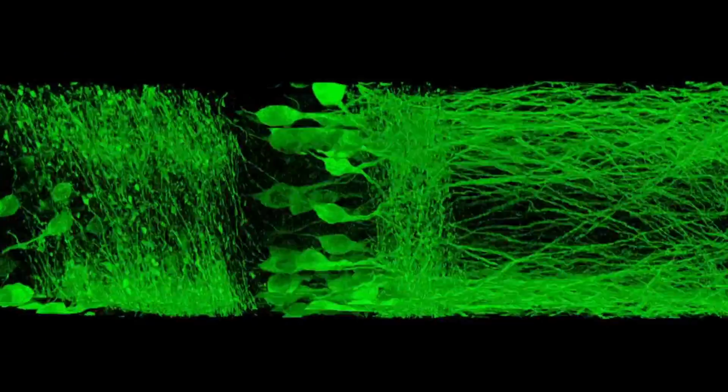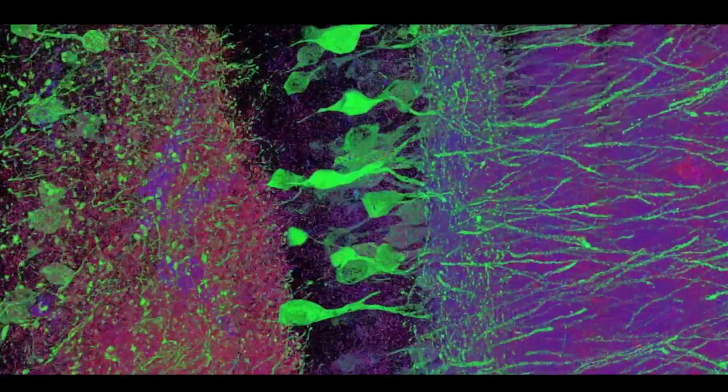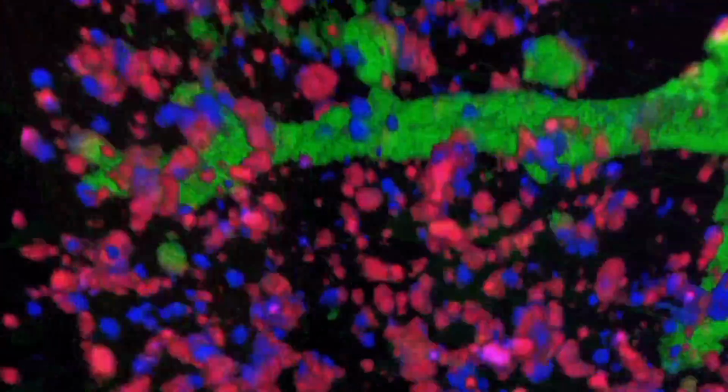With expansion microscopy, we can image whole 3D volumes at a resolution of tens of nanometers. What's cool about this is that you actually can start to try to navigate brain circuits. You can scan large chunks of brain tissue, but with nanoscale precision. And so we think that this technology can help a lot of different questions be answered in biology and in medicine.